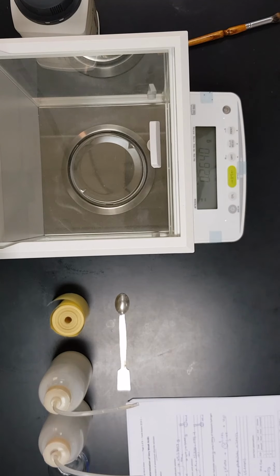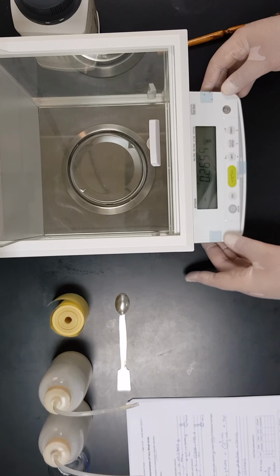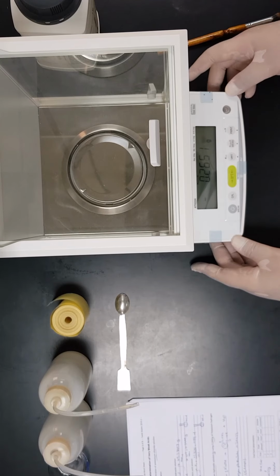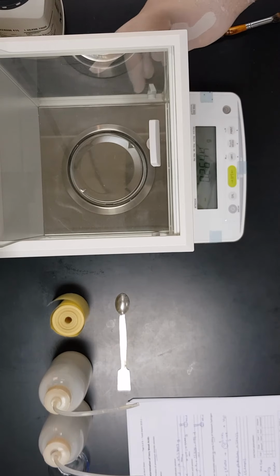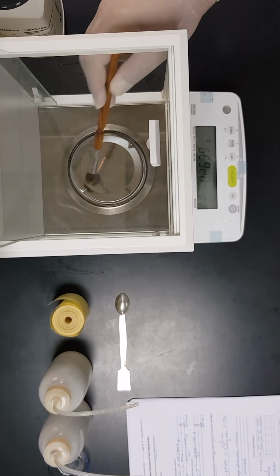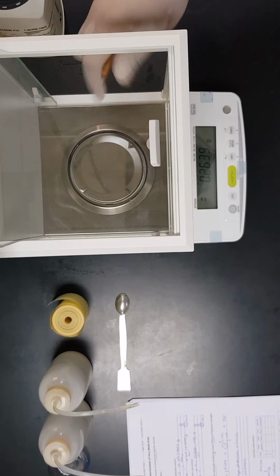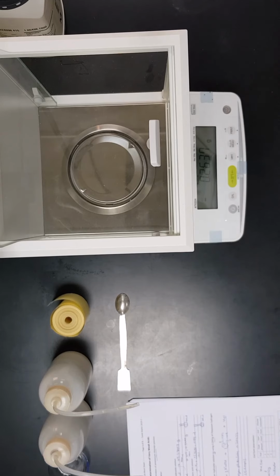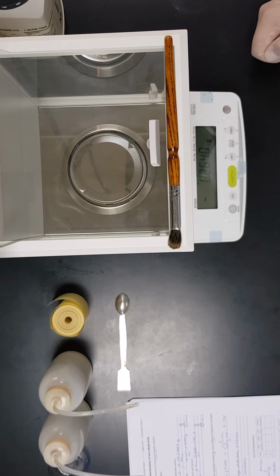Okay, we have to start first by leveling the analytical balance. So we have to adjust it here by this knob and make sure that the bubble is in the middle of the red circle. So yes, now it is leveled. And we have to make sure that all the surfaces of the analytical balance are clean, so we can take out any remaining dust. If it is necessary, we can remove the components of the analytical balance, clean them and return them back, but it's already clean. So now we are ready to use the analytical balance.